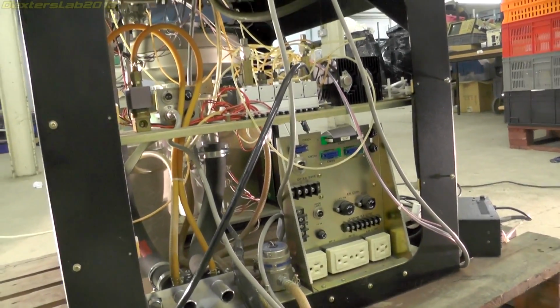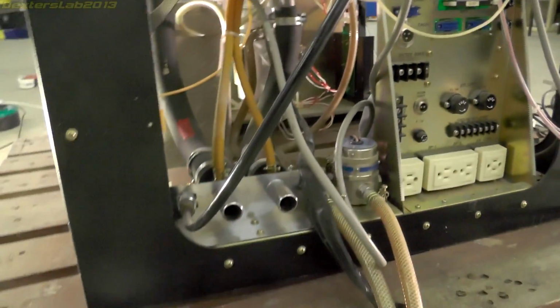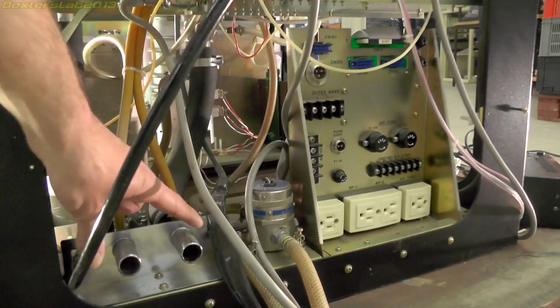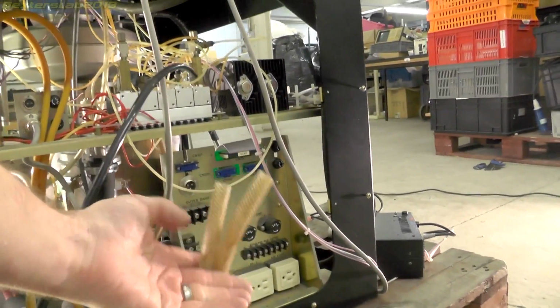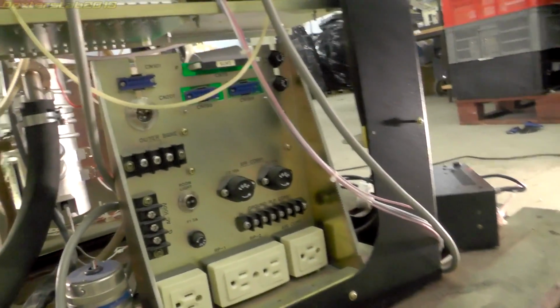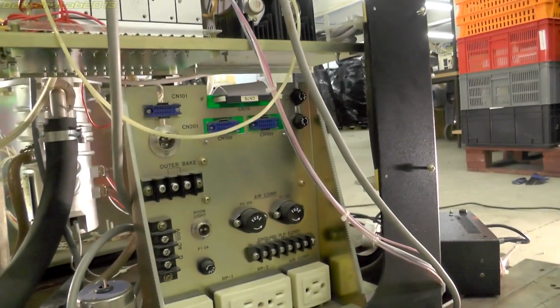Over on the back here, we've got a slightly better view of those valves and controls. We have these two vacuum ports. So one is for the main chamber and one is for the sample exchange chamber. These two pipes here, which have been cut, would have been the water cooling pipes for the diffusion pump. And we've got a number of sockets and connections there for all the electrical stuff.